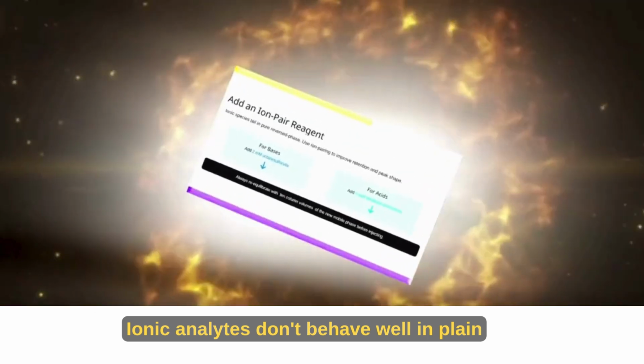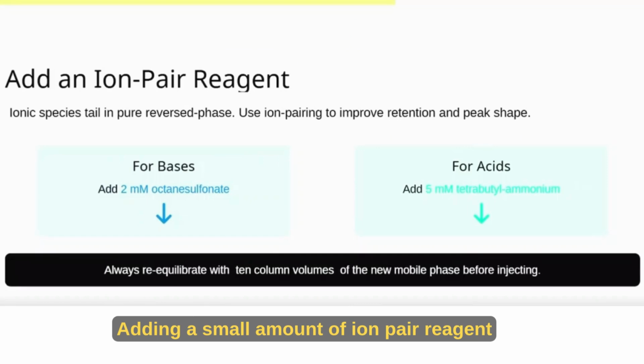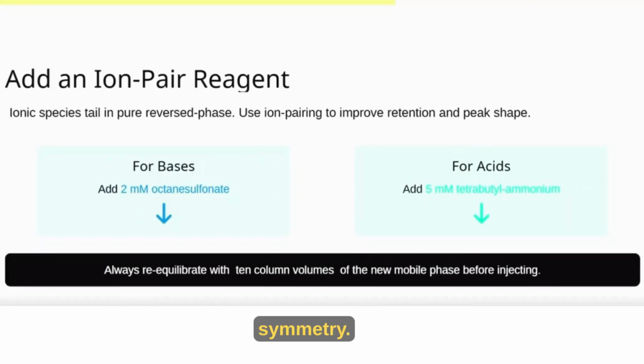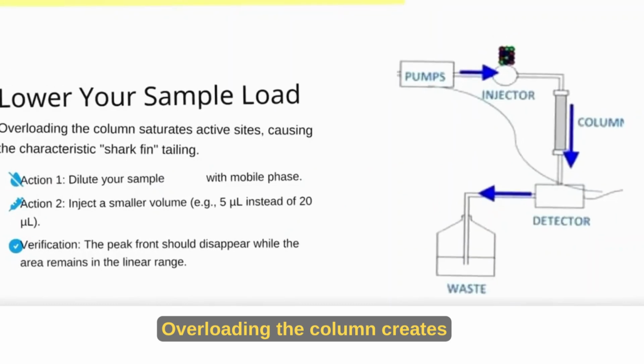Add an ion pair reagent. Ionic analytes don't behave well in plain reversed phase systems. Adding a small amount of ion pair reagent balances charge interactions and improves symmetry. Always re-equilibrate thoroughly before your next injection.